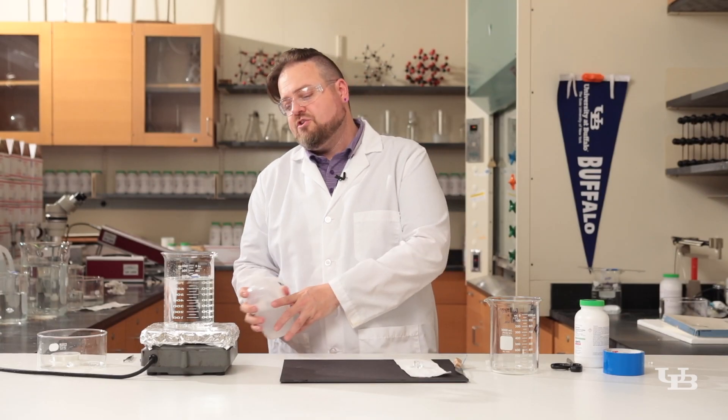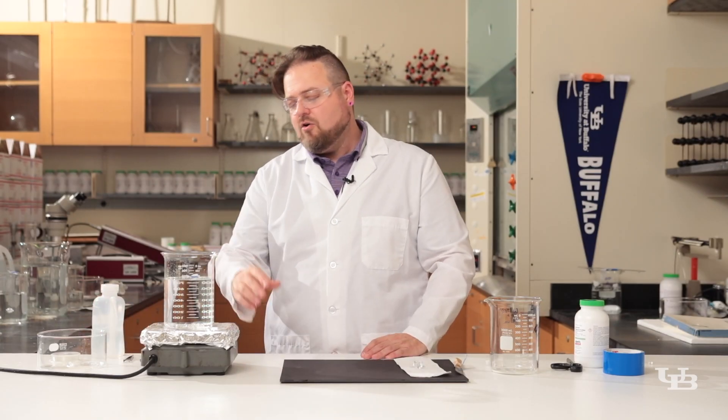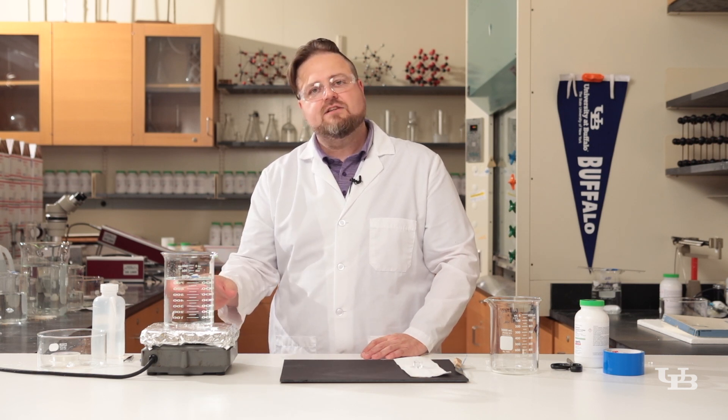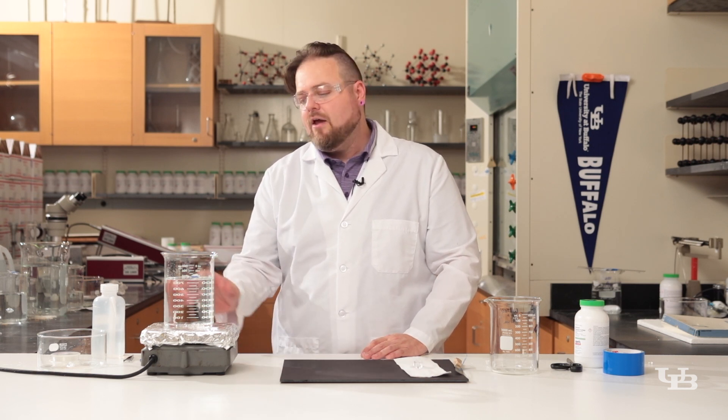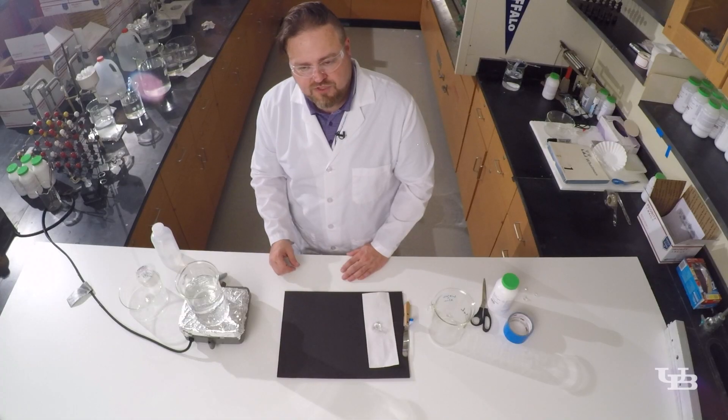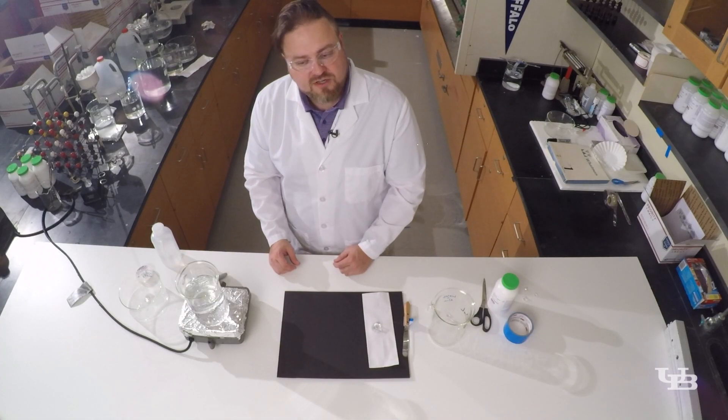We're going to heat this up until all of these crystals dissolve. We're going to let this solution cool back down and once the solution is returned to room temperature we'll reintroduce our seed crystal.